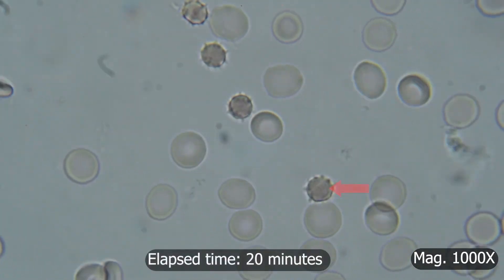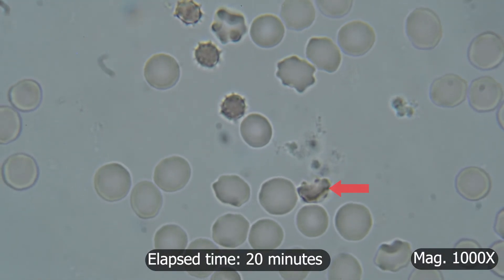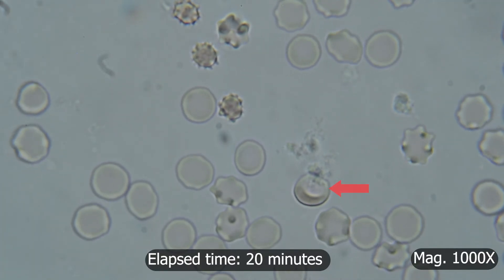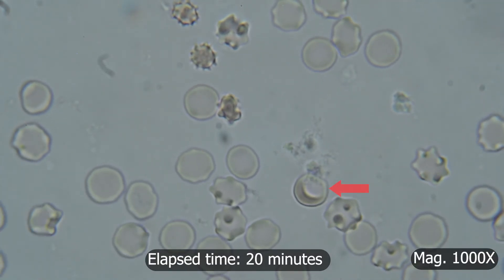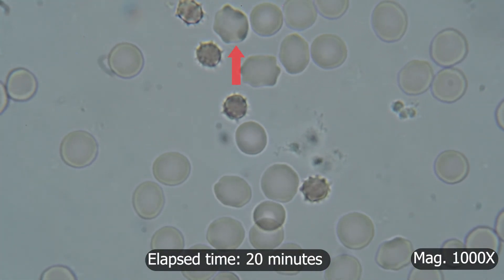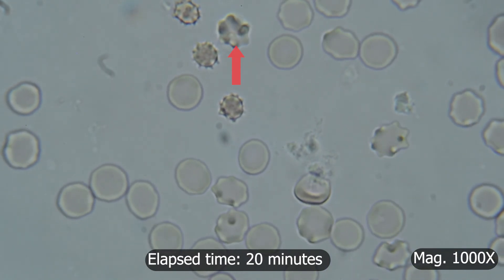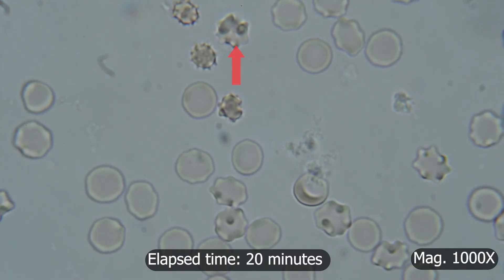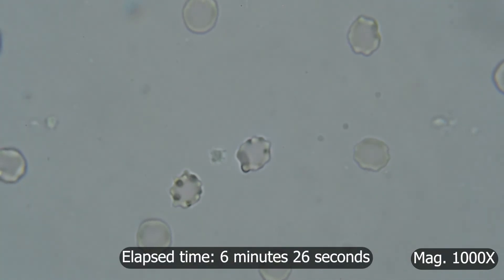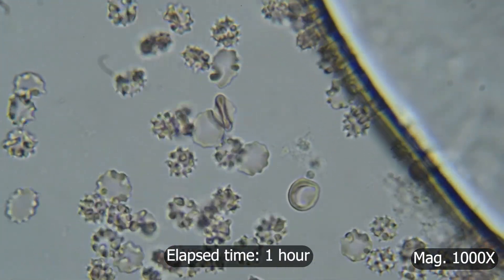This cell here actually gains water and returns to its original shape. I have no idea why it does that, considering the cell above it, which is only a few micrometers away, does the opposite and shrinks. It seems each cell responds differently — maybe because these cells all have a different age, or maybe it's something else. Given enough time, most cells will lose water and eventually shrink.